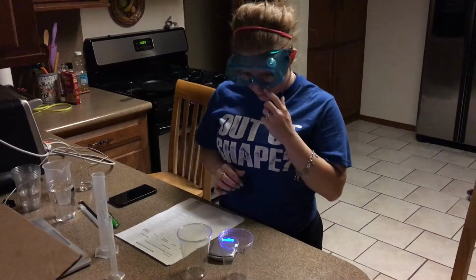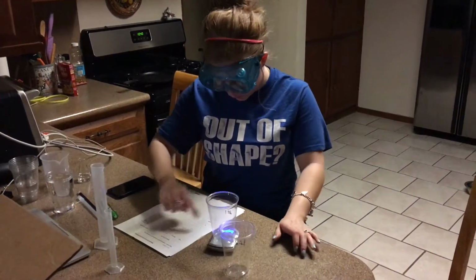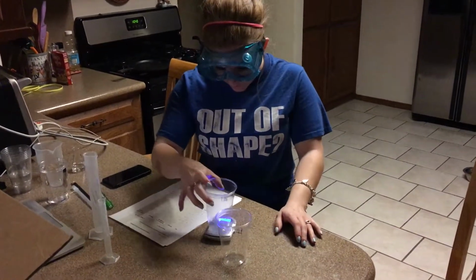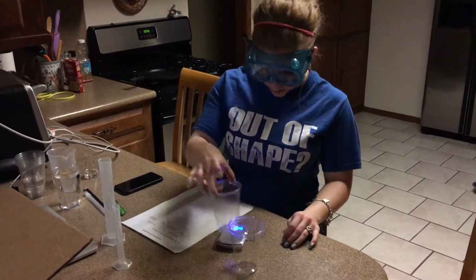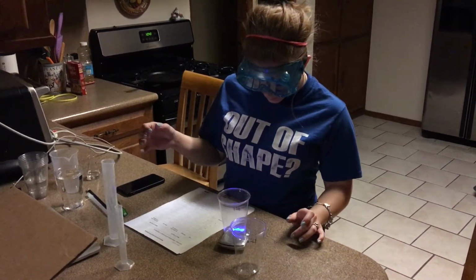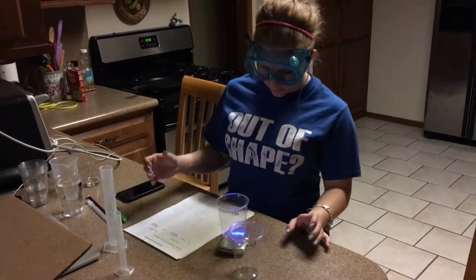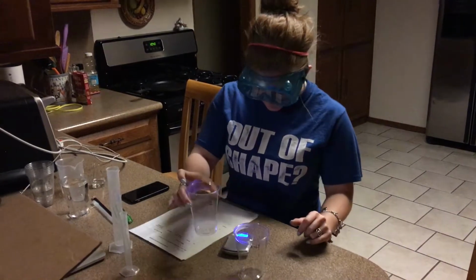So you turn your little scale on and weigh it. There are 5 trials, and then you're supposed to find an average. For each of them, I keep getting 10.13. I'll do it again. 10.13. It's just repeating constantly because they're literally the same cup and both empty.